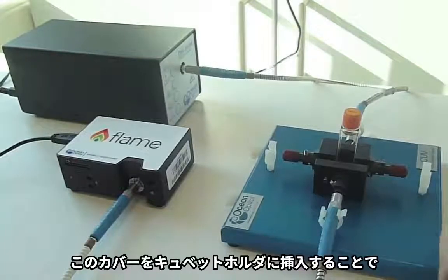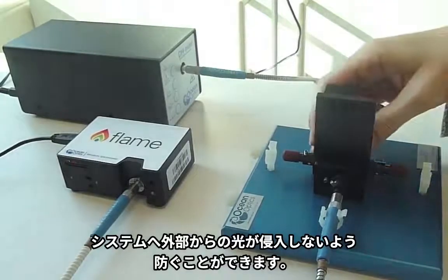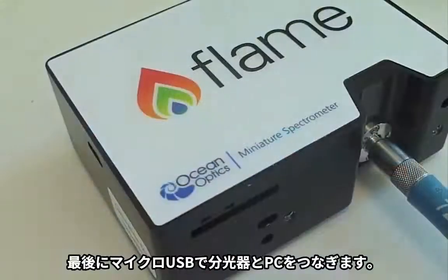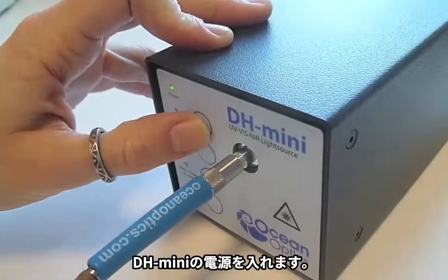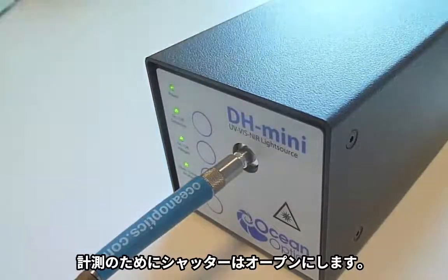The CUV cuvette holder also comes with a cuvette cover that can be placed over the sample like so to prevent external light getting into the system. Finally, make sure that your spectrometer is plugged into your computer with the micro USB cable and switch on your light source. The DH-Mini features a shutter. Make sure this is open before taking measurements.